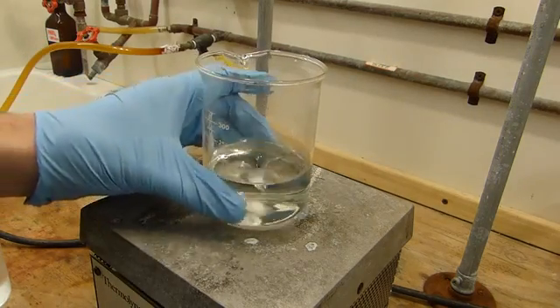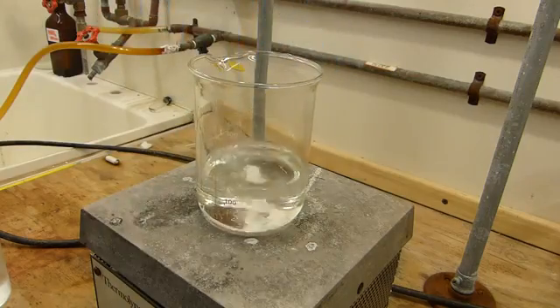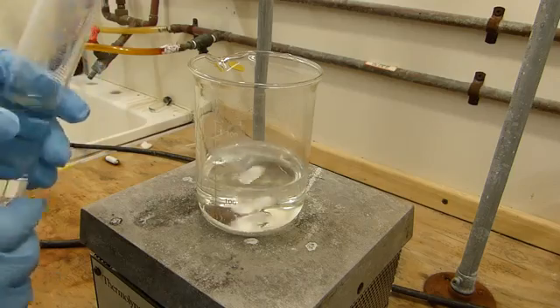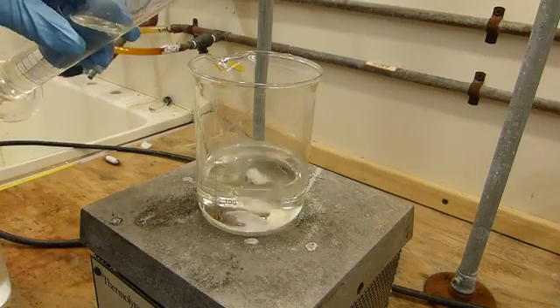The benzoic acid is now completely dissolved as you can see by the clarity of the solution. I'm now going to add the hydrochloric acid to precipitate the benzoic acid. This should be fairly dramatic.